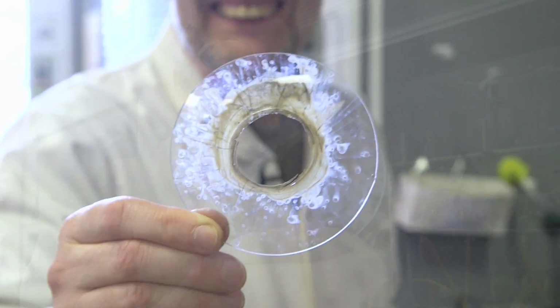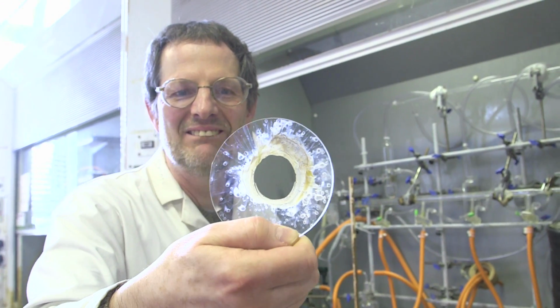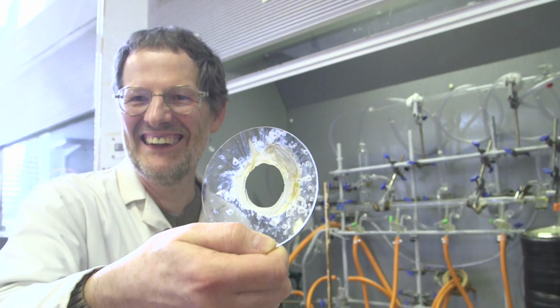We've never seen it do that before. It normally either shatters or it just about holds, but I've never seen a holey experiment like this.